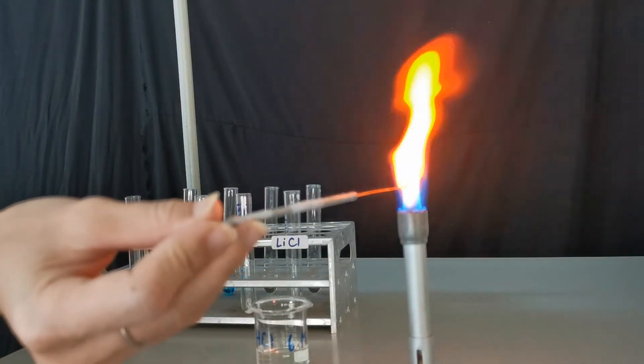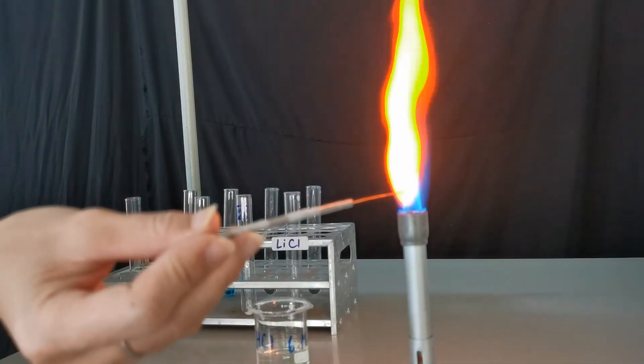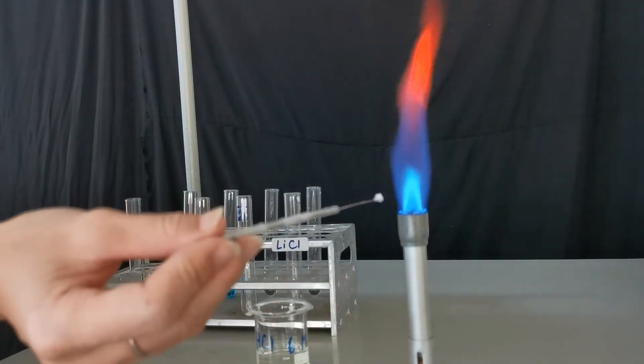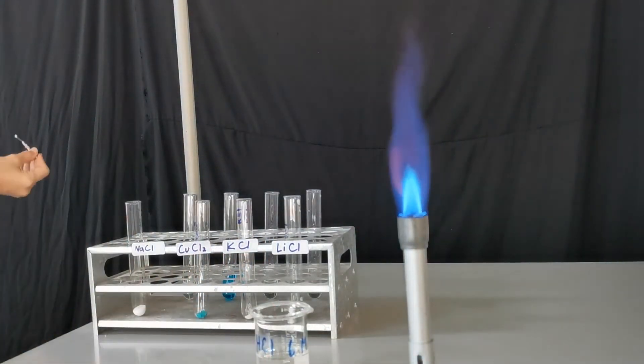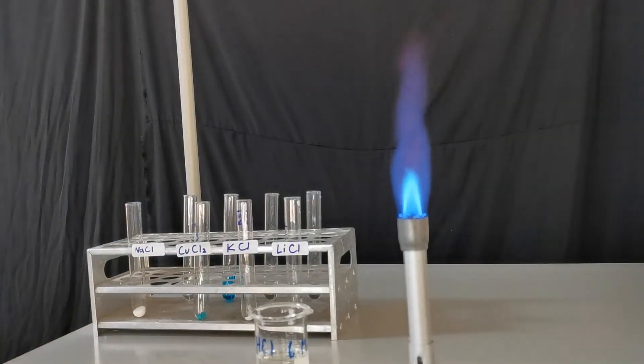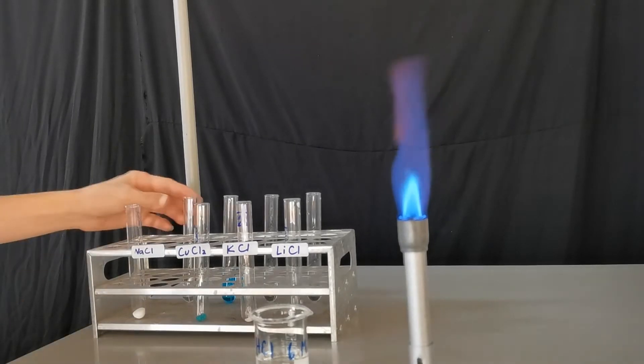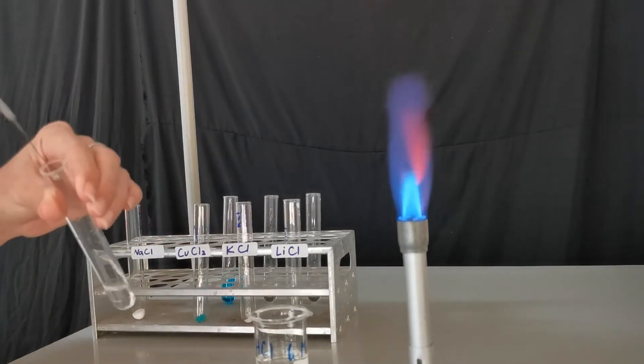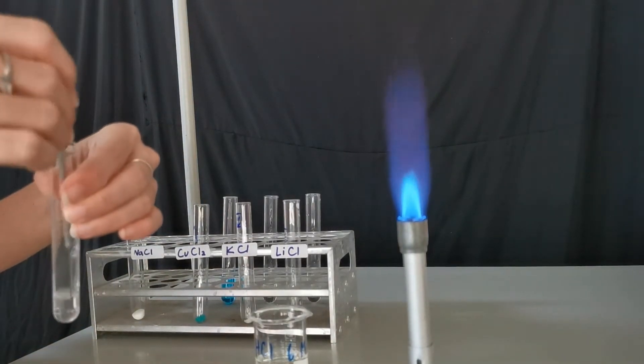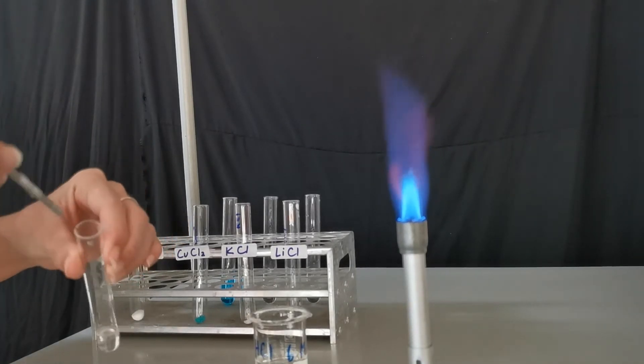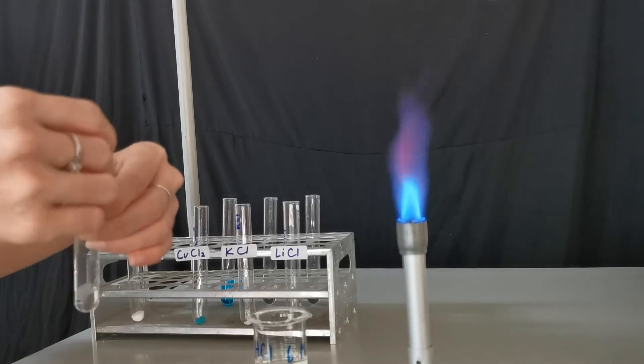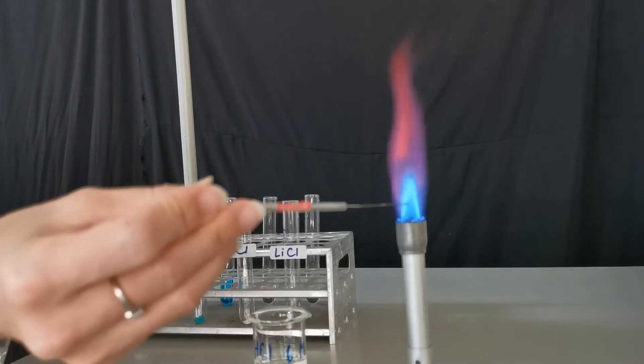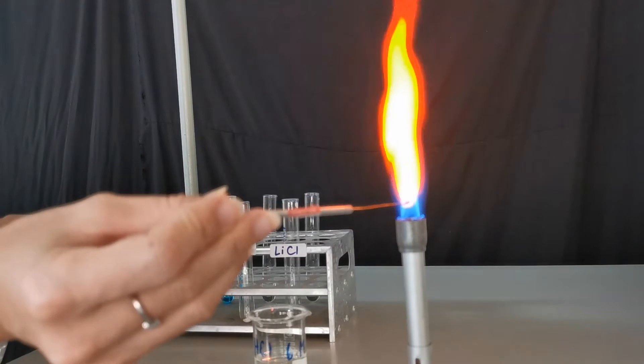For sodium you can see this distinct yellow flame. And if we repeat the process using the solution, we will also see a similar color of flame. Yellow.